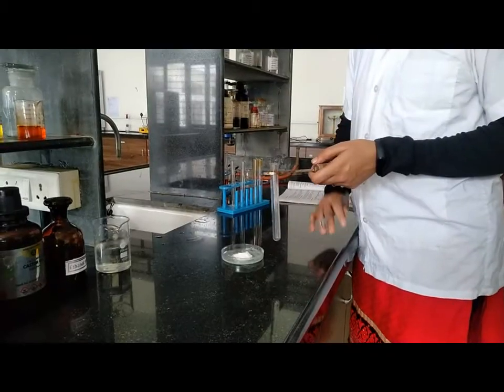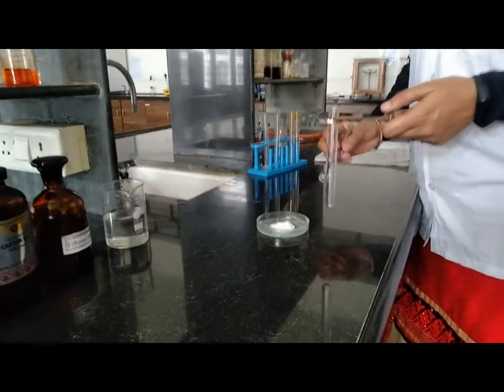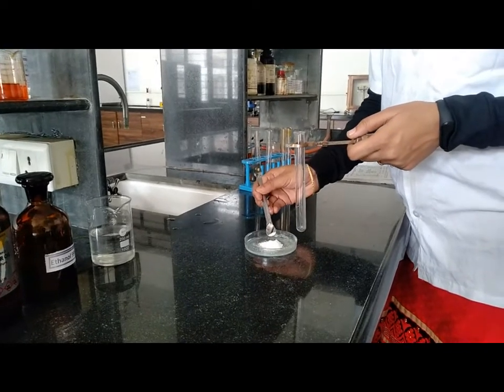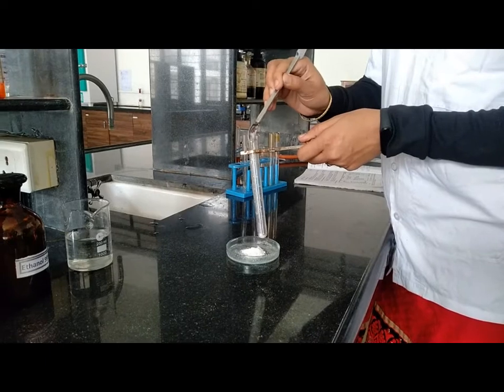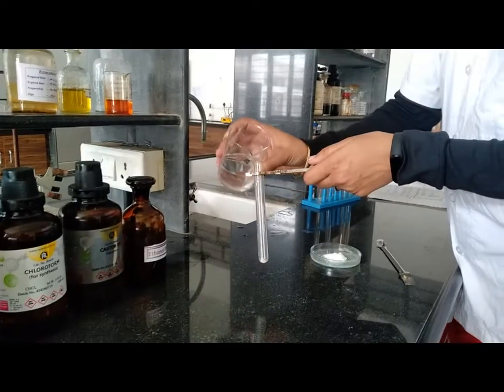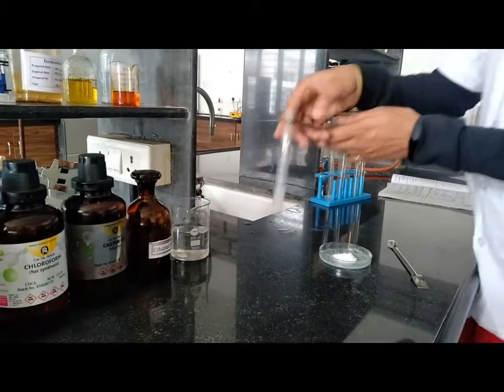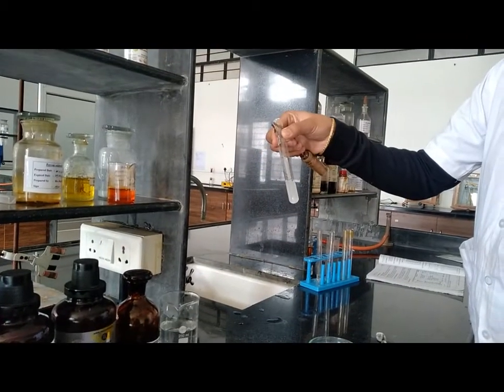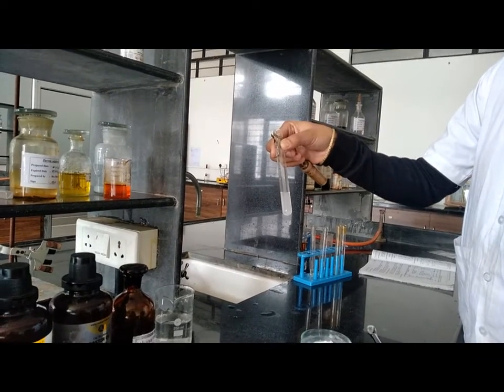Now starting with solubility test in different solvents. First, solubility in water: take approximately 0.2 grams of sample, add water, shake vigorously and check the solubility. Ampicillin trihydrate is slightly soluble in water.